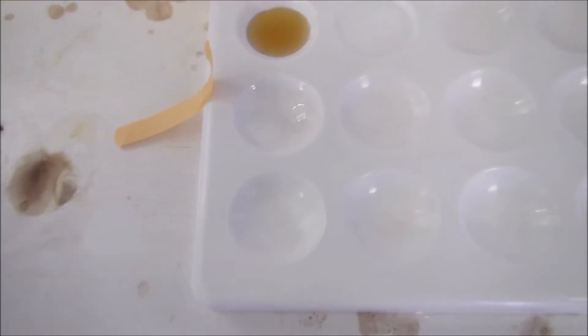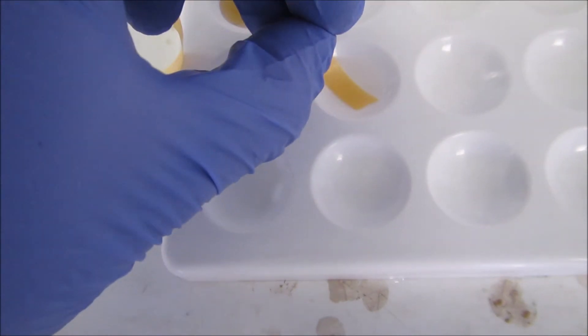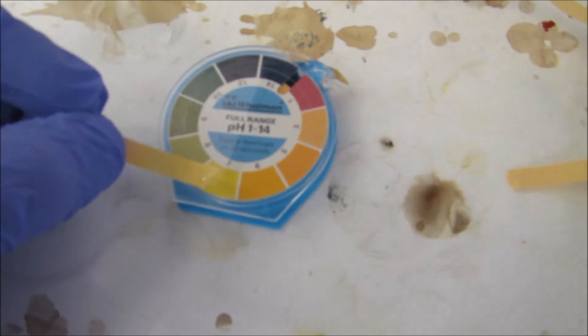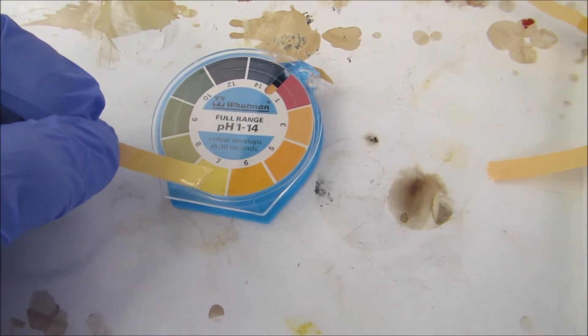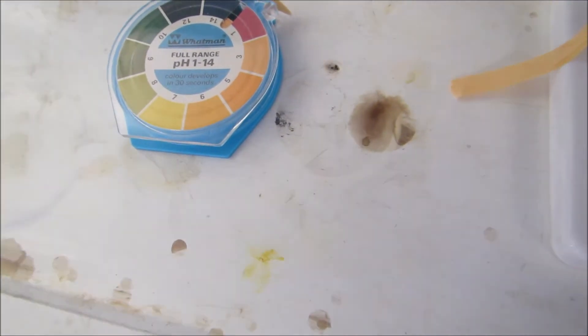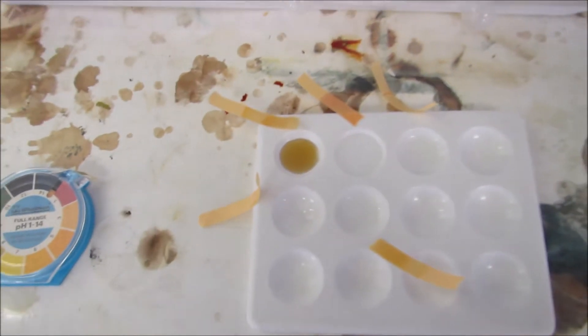And our final one is our alcohol, and again pH 7, so around neutral.